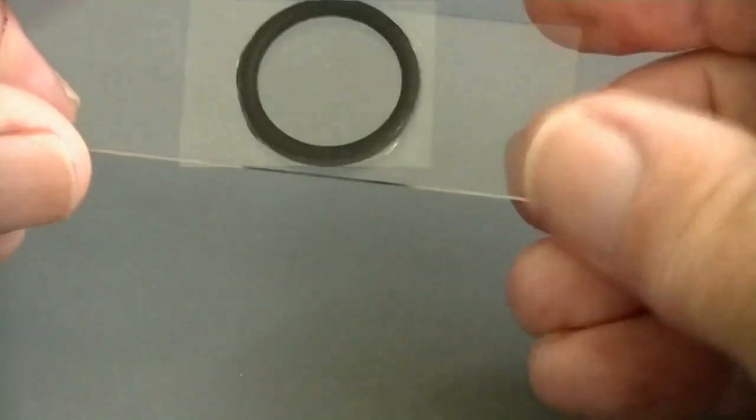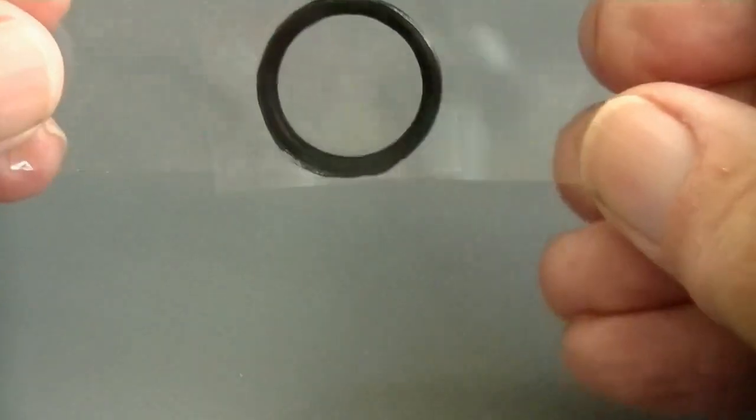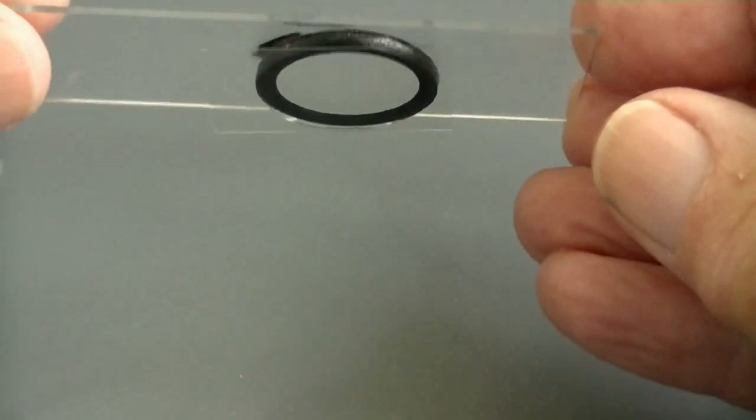So there's the O-ring in position, held there by surface tension and the Vaseline.